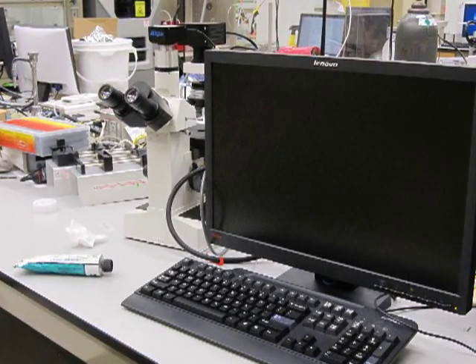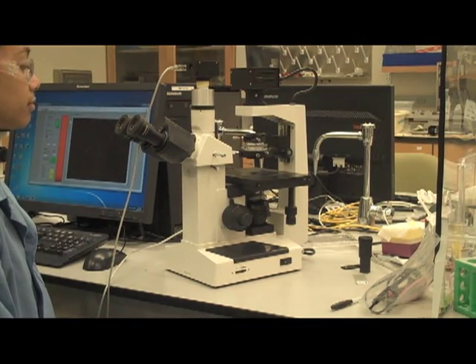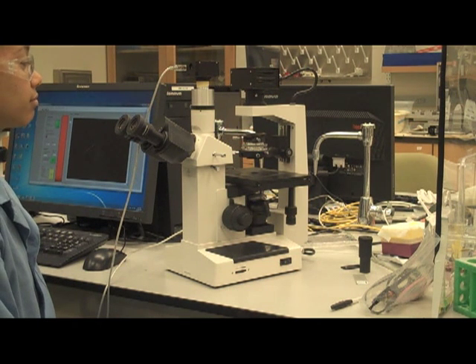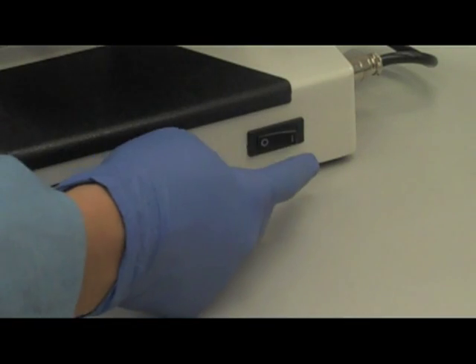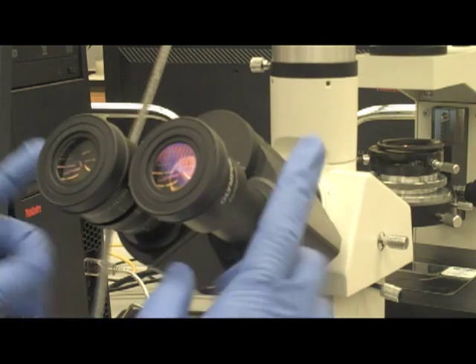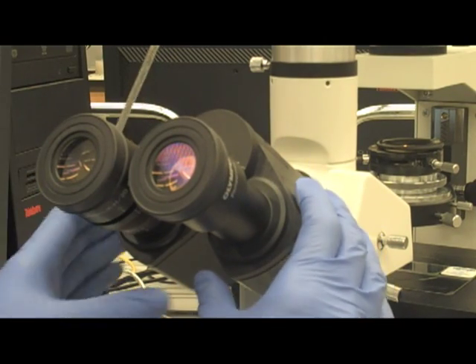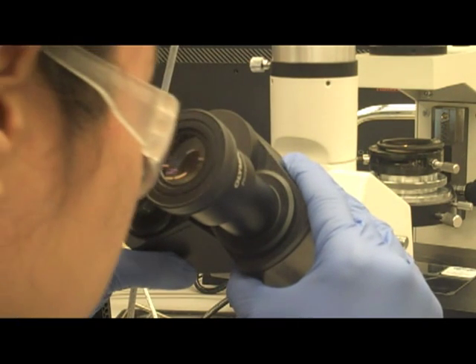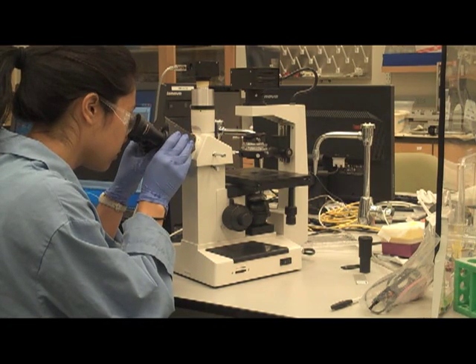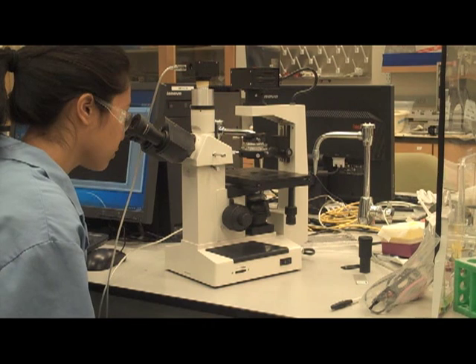Step 1: Push the power switch located on the side of the microscope near the base to turn it on. At the top of the microscope facing you, you should find two eyepieces. When using the scope, be sure to look into both eyepieces at the same time. By manually adjusting the base of the eyepiece, you can change the space of the two pieces to a comfortable fit for your view.